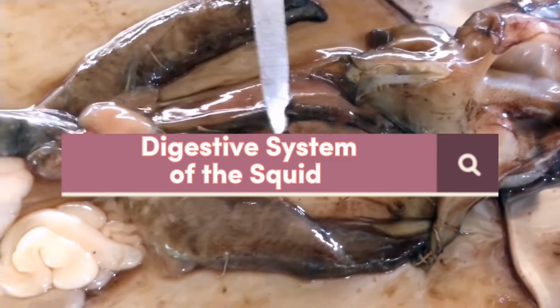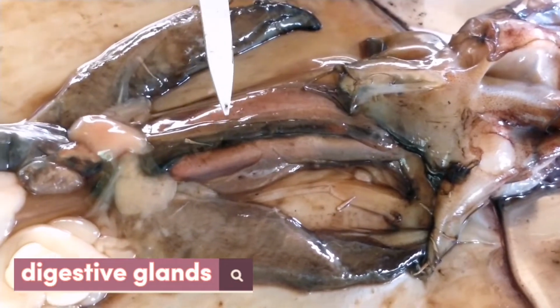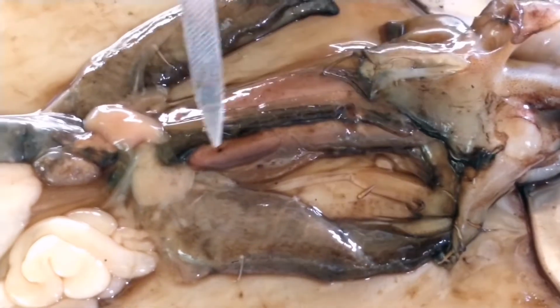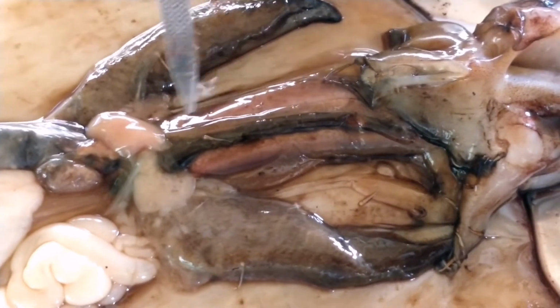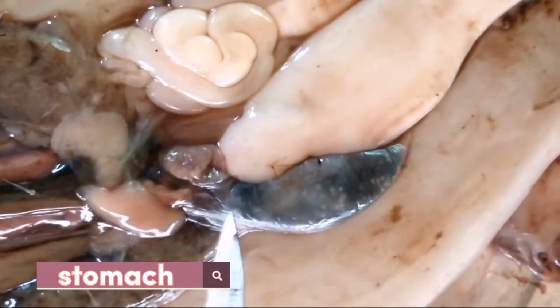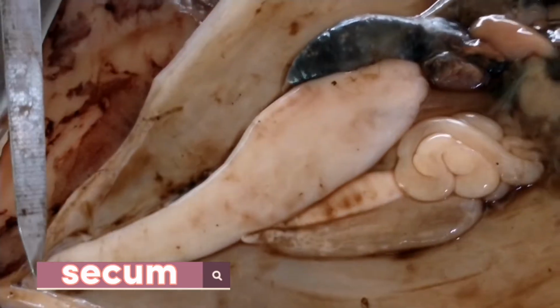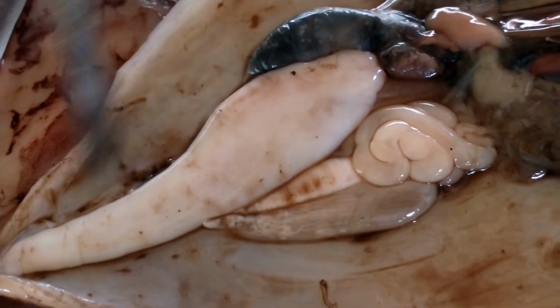And now let's move on to the digestive system of the squid. This structure right here is the digestive gland, which releases digestive enzymes to help break down food. It is also called the liver of the squid because it does a lot of typical liver functions like detoxification. And this dark structure right here is the stomach. This pouch-like structure, the food passes straight from the stomach into the cecum. And this white large structure right here is the cecum, which is where most of the nutrient absorption takes place.